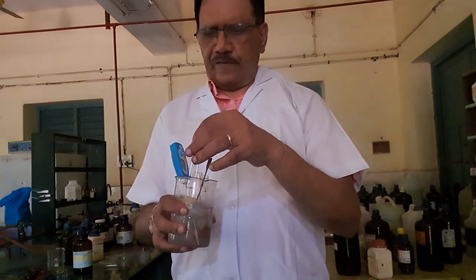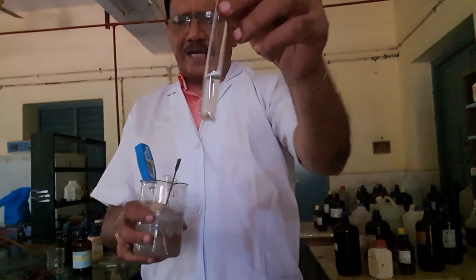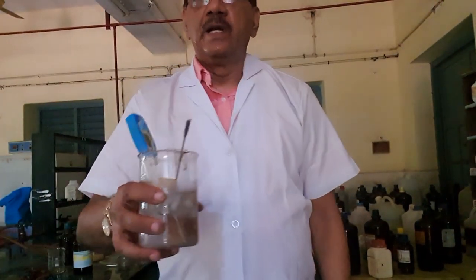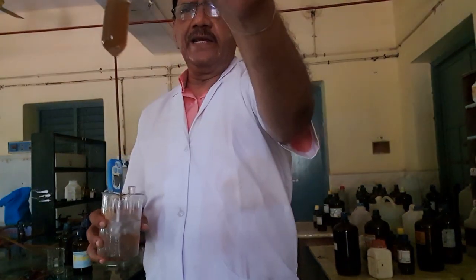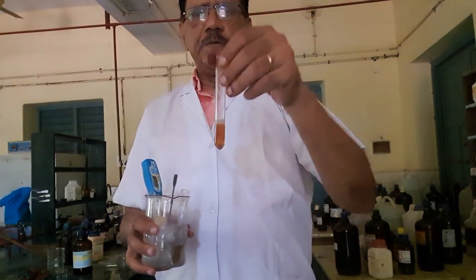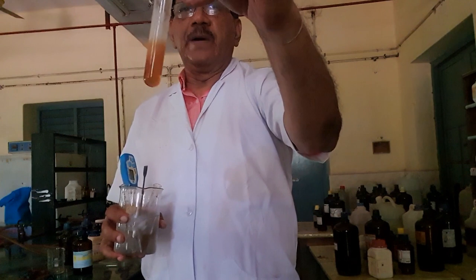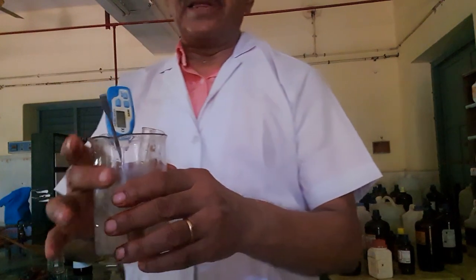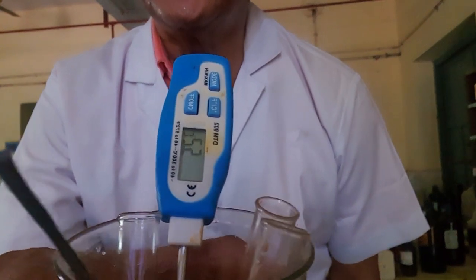Test tube 1, kindly follow, sodium nitrite in water. I am keeping it in the ice water. Kindly see, there is ice. Then we have the aniline in dilute HCl. And the third test tube, beta-naphthol in sodium hydroxide. So what we have to do now, by keeping all the 3 test tubes, see the temperature. You should attain 0 degrees.